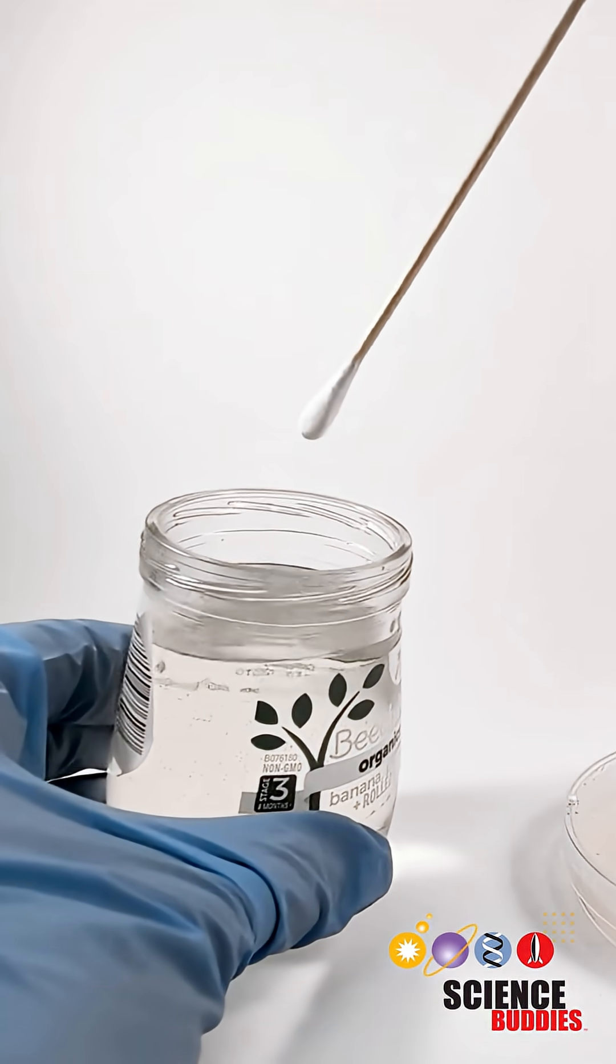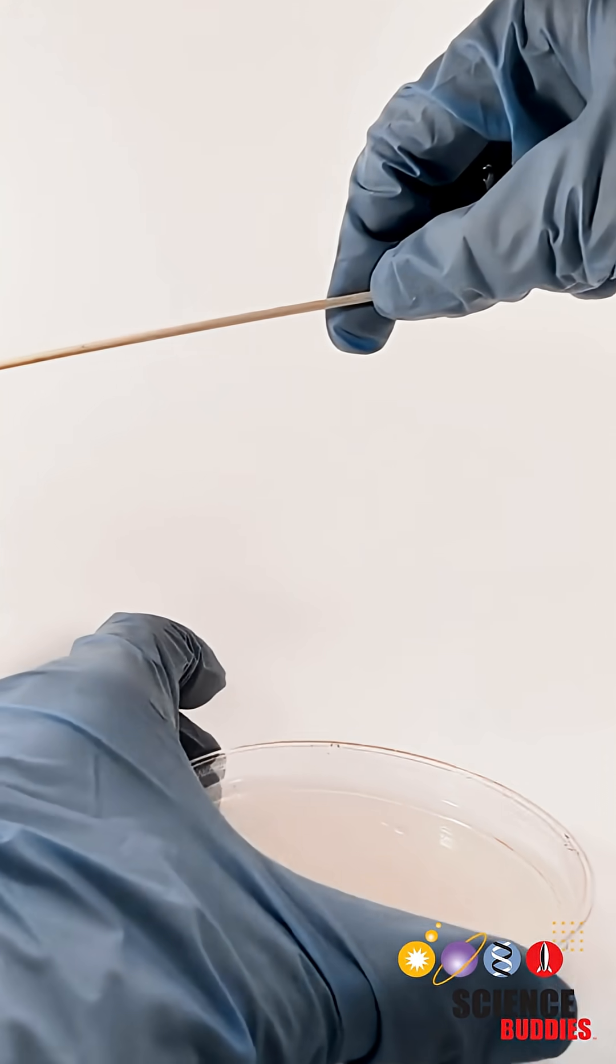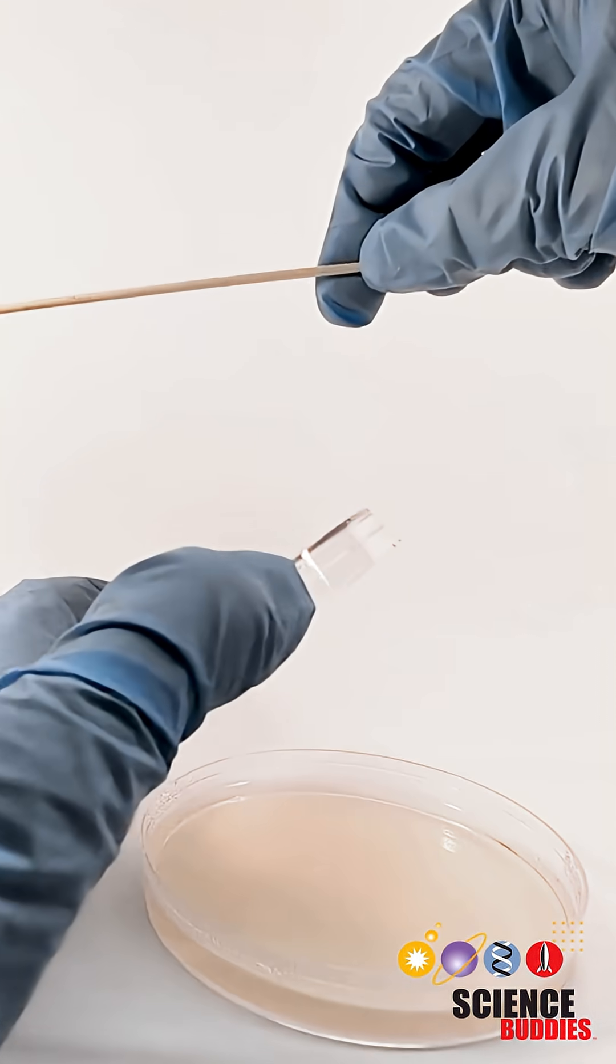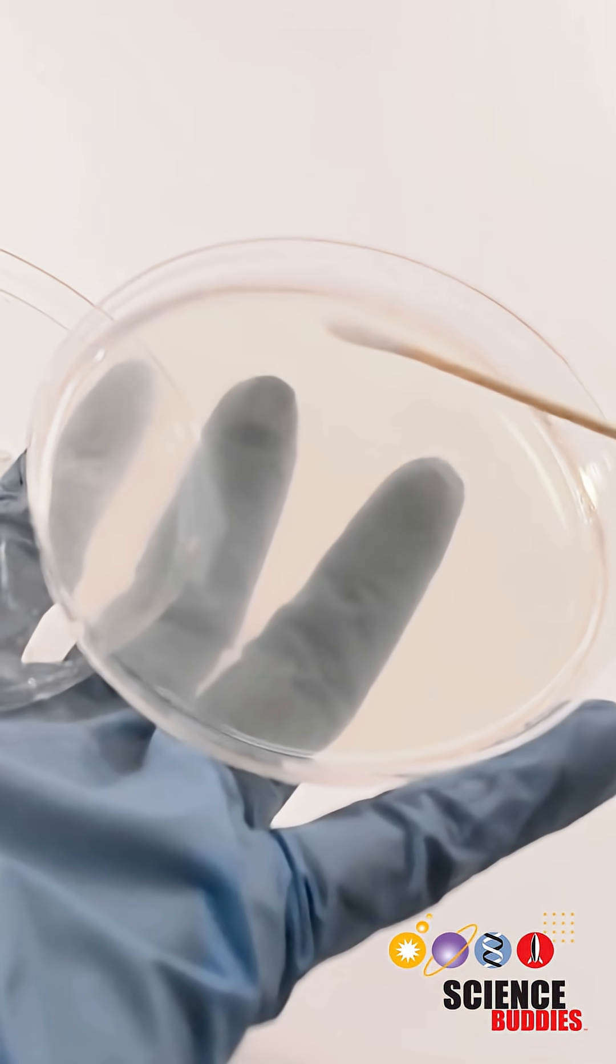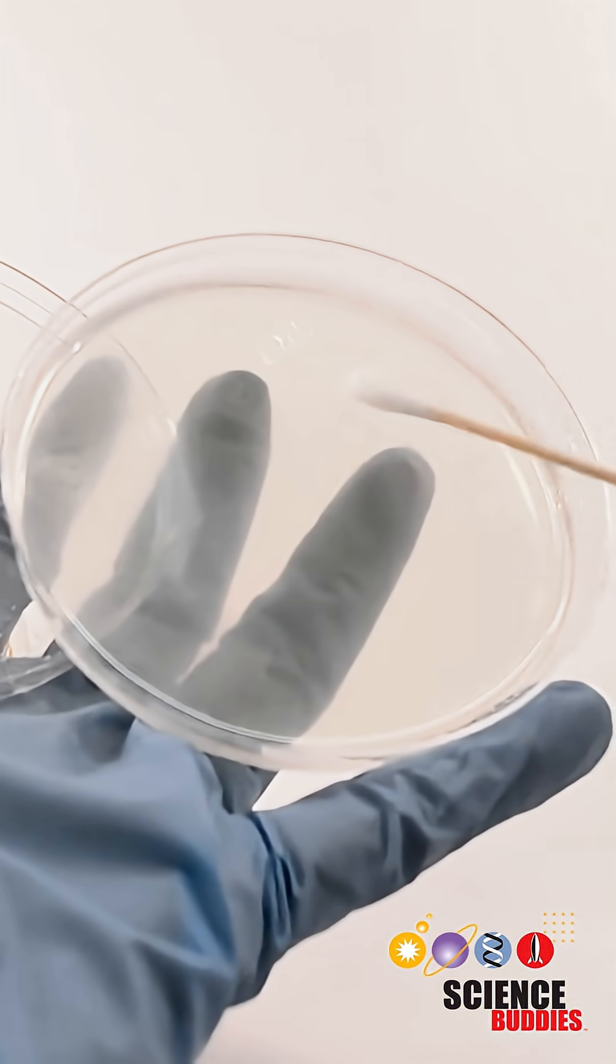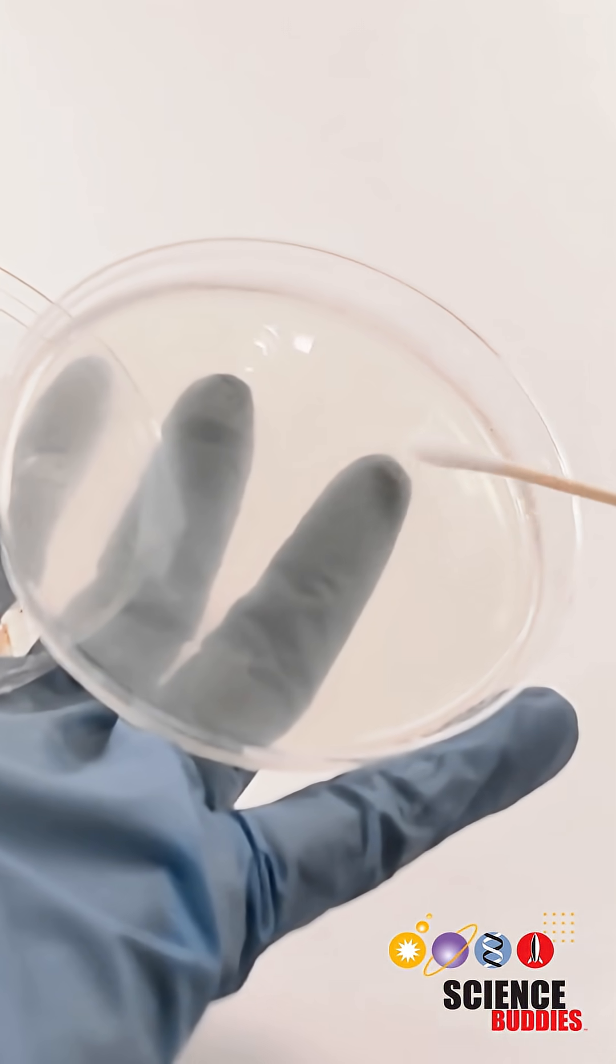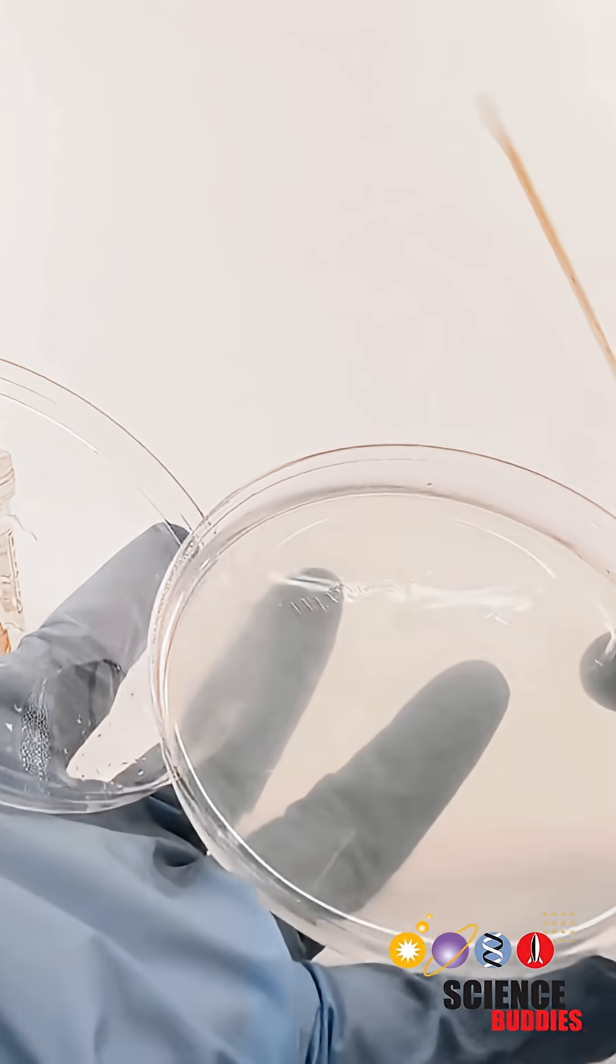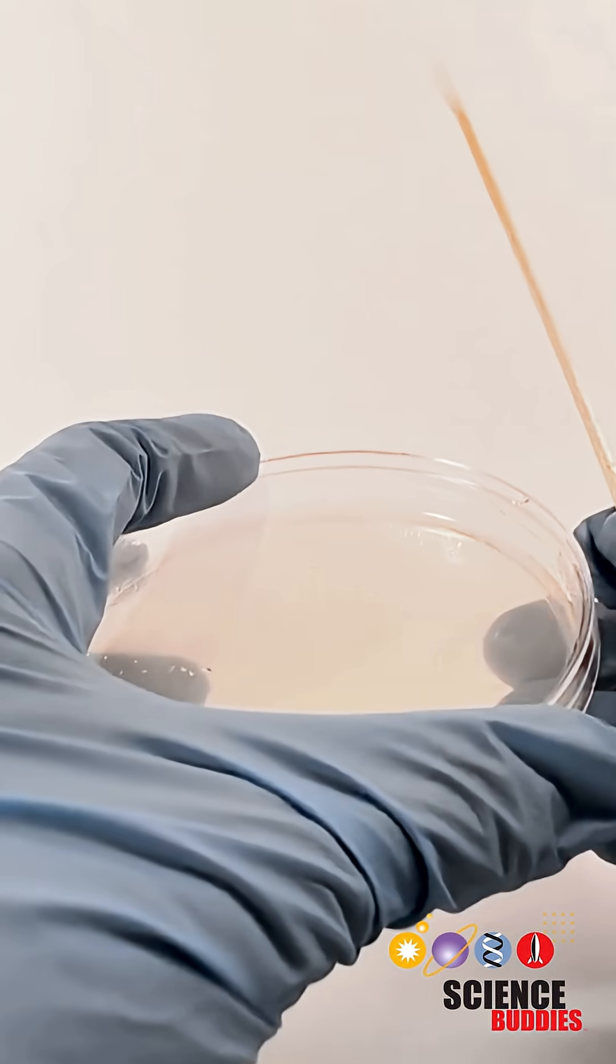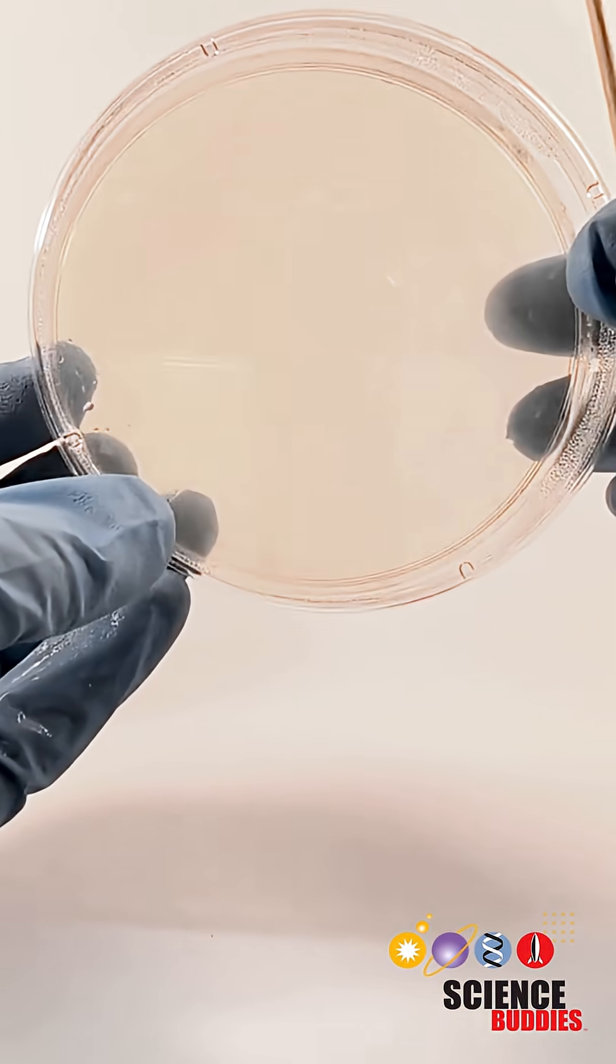You can dip it into your samples, swirl it around, and then we're just going to do a simple zigzag pattern on the plate. I'm going to go all the way to the edge, all the way top and bottom like that.